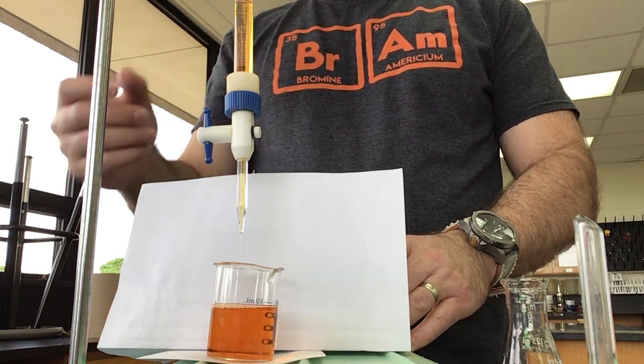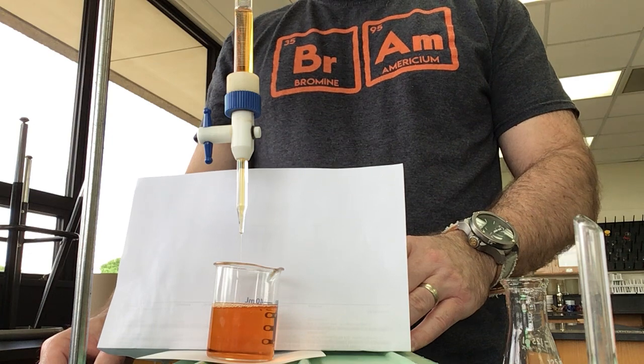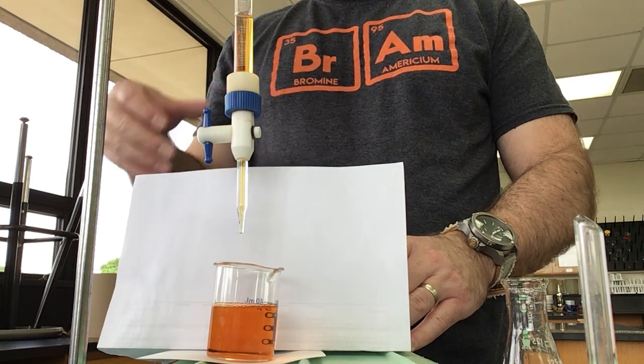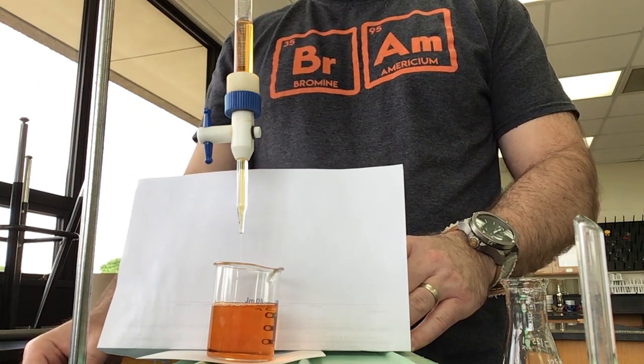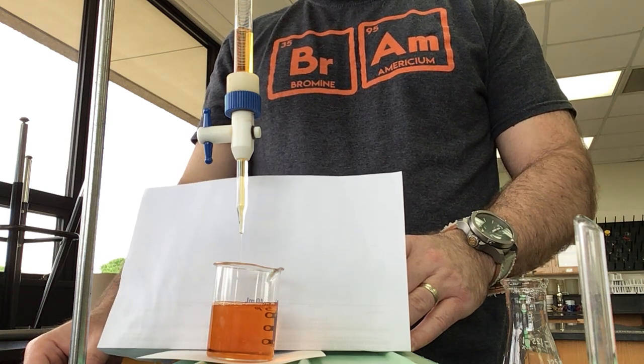So we're going to let this drain out and then give it a couple of rinses with water. I'll just take another couple seconds to get this all the way drained.